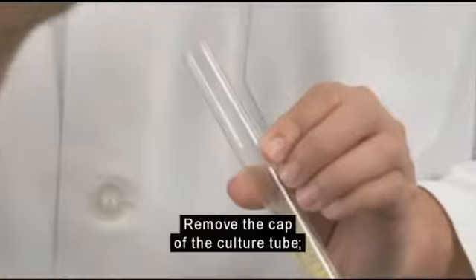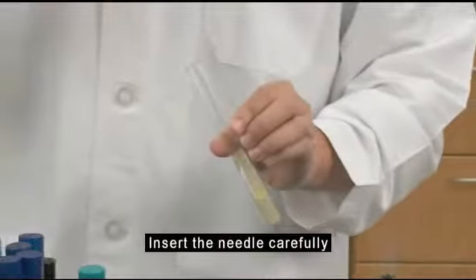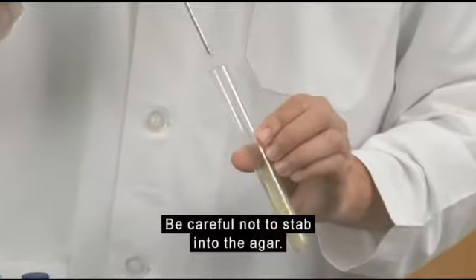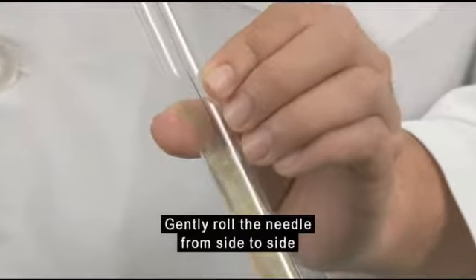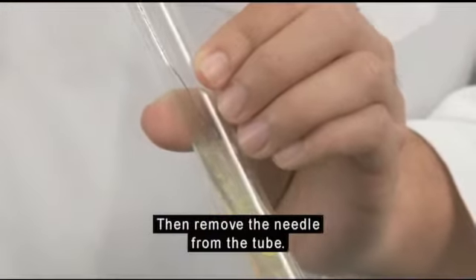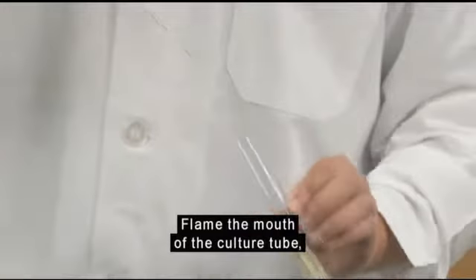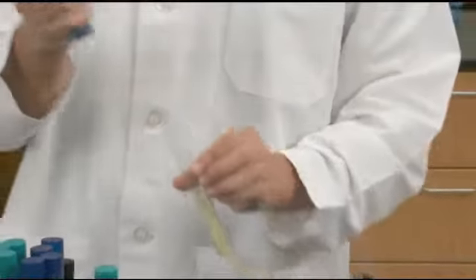Remove the cap of the culture tube, then flame the mouth of the tube. Insert the needle carefully and touch the side of the wire to the growth. Be careful not to stab into the agar. Gently roll the needle from side to side on the growth surface to pick up some of the growth. Then remove the needle from the tube. Flame the mouth of the culture tube, then recap and return it to the test tube rack.